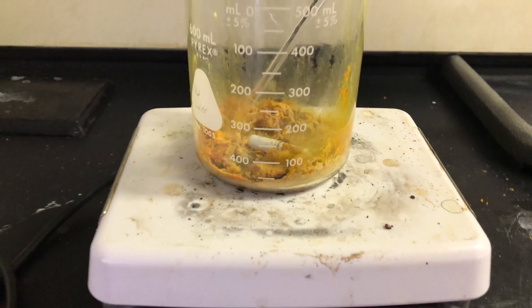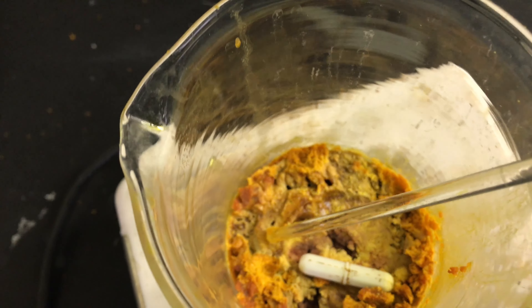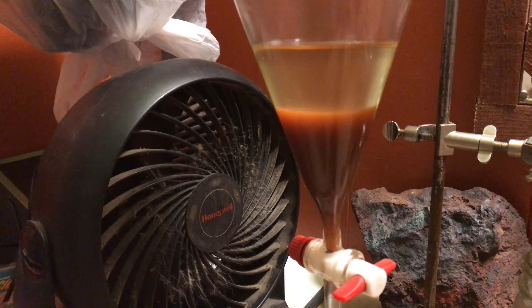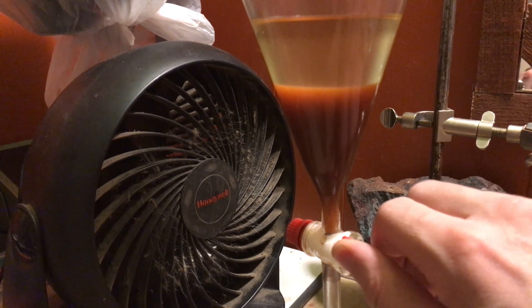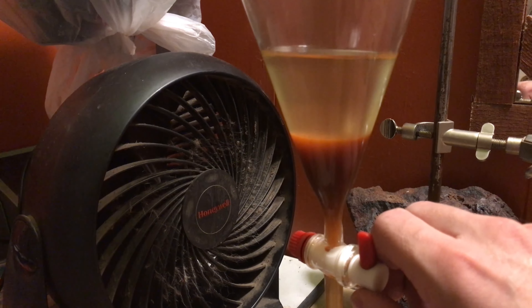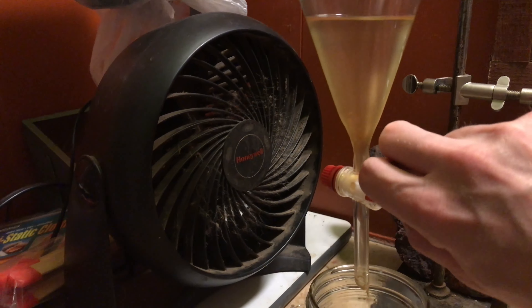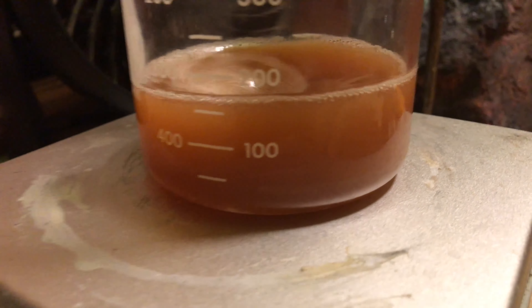It looked a little more orange-yellow than I had anticipated. I read that this is due to the presence of iron. I put the residue back into water solution, then shook the solution with acetone, which selectively extracts iron salts. Evidently, iron is a common contaminant in manganese oxides purchased for ceramics.